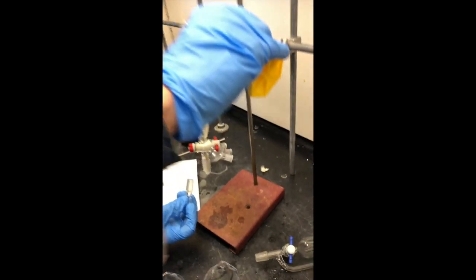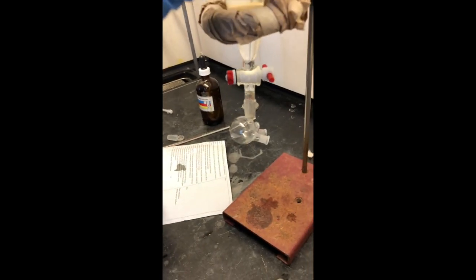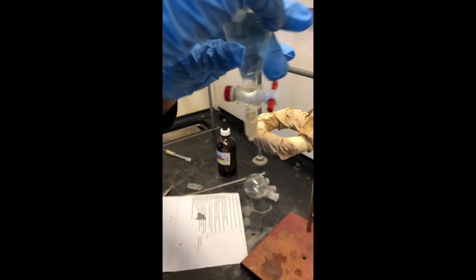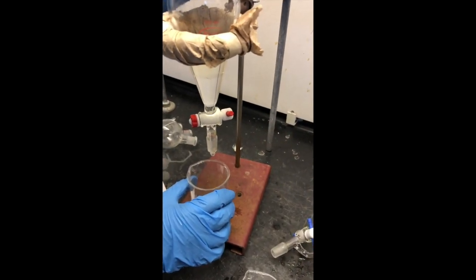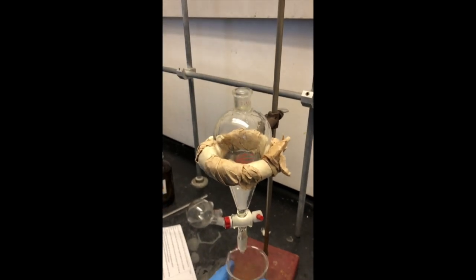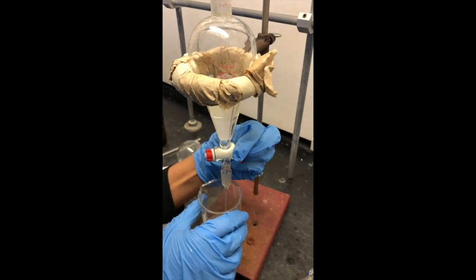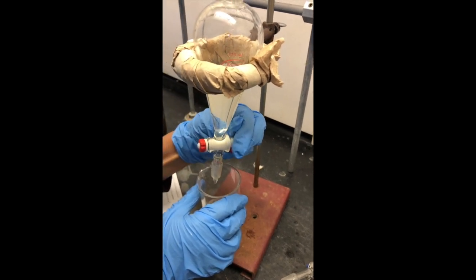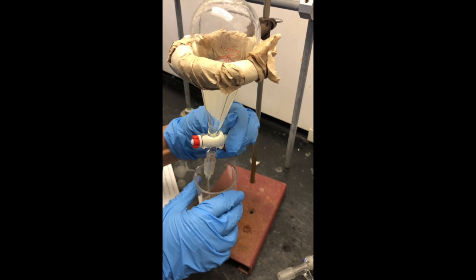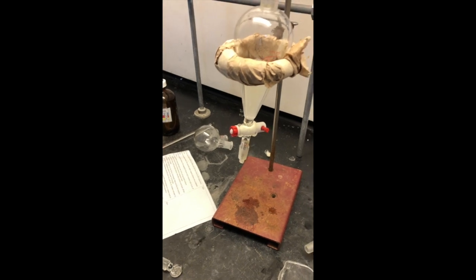Sodium chloride is going in next — it won't sink to the bottom the same way. This is our salting-out step. We still have that piece of magnesium in there. We give it a good rinsing, then we're ready to drain out the last aqueous wash and remove the top to drain that last bit out. Then we'll get the calcium chloride and we're just about ready to dry this. We're draining the aqueous layer out the bottom, then pouring the organic layer into a clean beaker so that we can dry it.